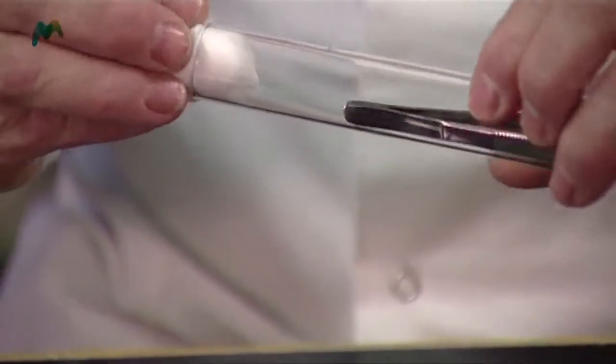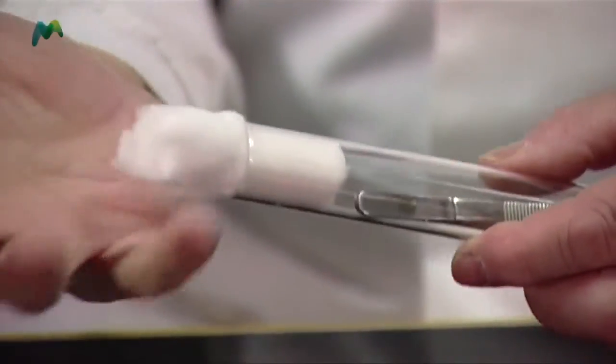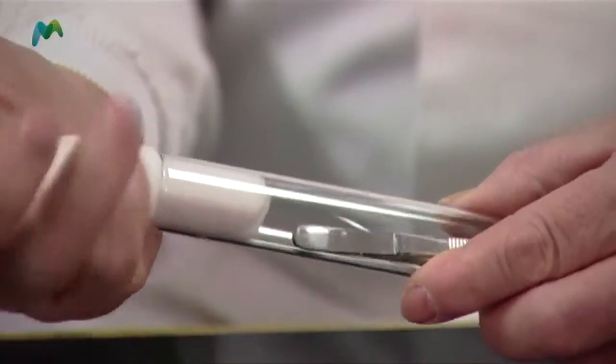All I'm going to do now is pull a little piece off, and then when I fold it in half and roll it up, it should fit in much more easily and successfully. The secret is when you put it in to gently twist — as you twist it tightens and fits. I need a decent amount in my hand and a decent amount in there, because we're going to autoclave this and put it in an environment with lots of moisture. So I'm going to put a piece of aluminium foil over the top to prevent condensation when the autoclave cools down.